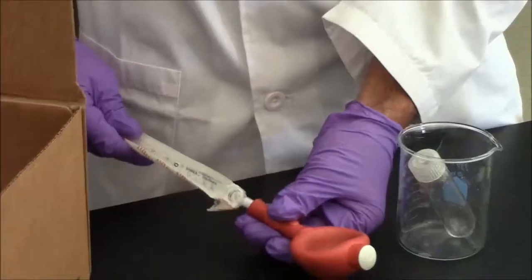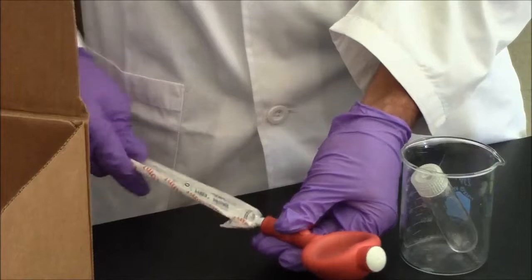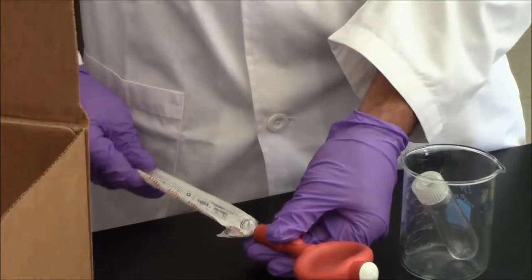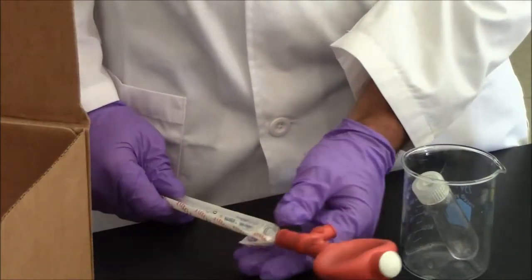Then you'll attach the rubber bulb as shown here. Don't jam the pipette in too far, just snug, not all the way into the bulb.